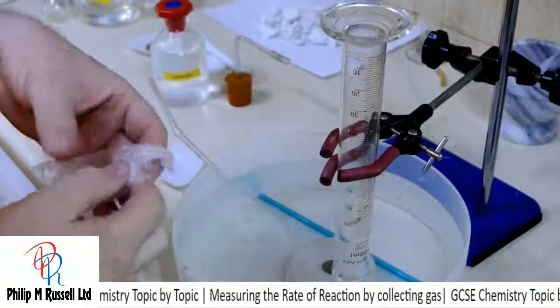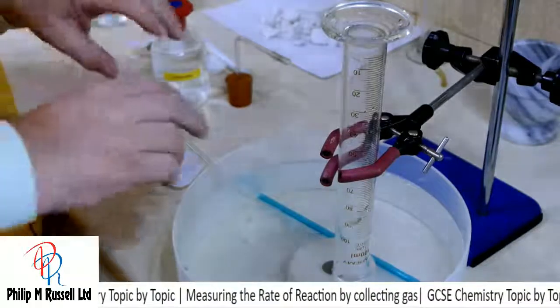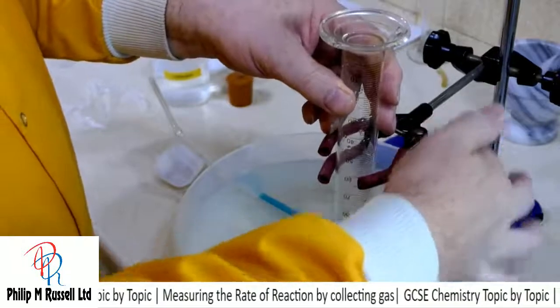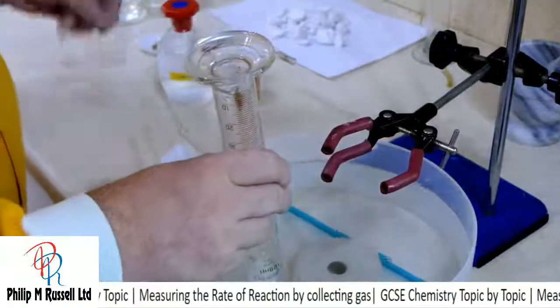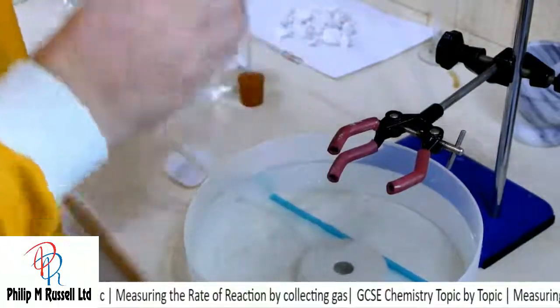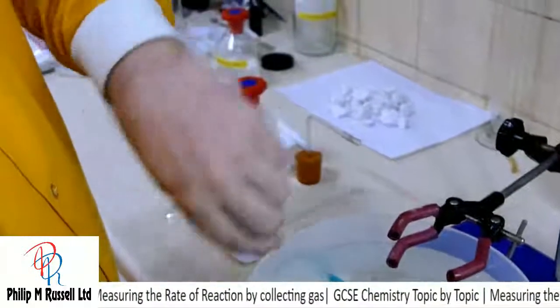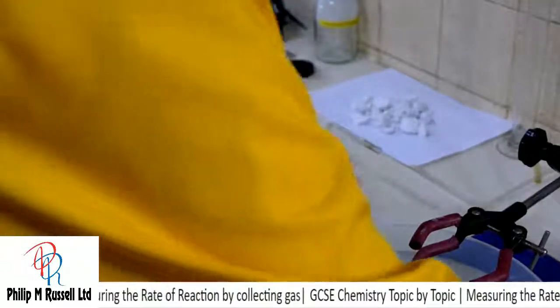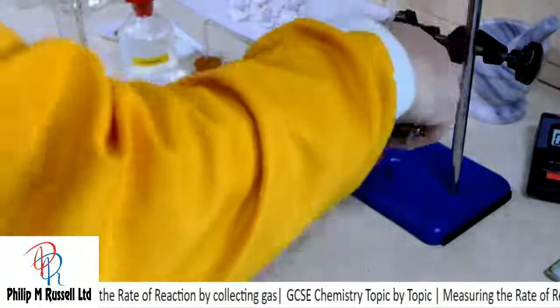I'm going to take my cling film, and I'm just going to undo this, and put the cling film over the top just to try and keep the gas in there, and move bits and pieces out of the way so I can do the experiment.